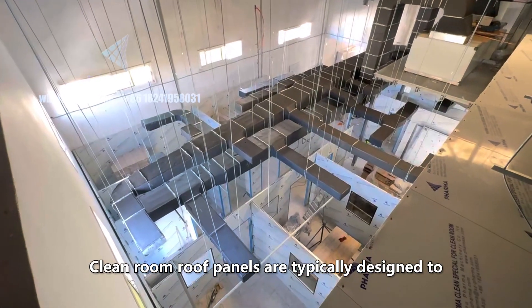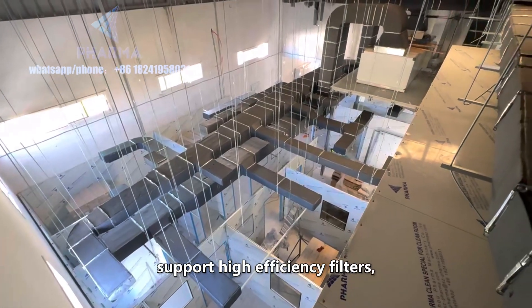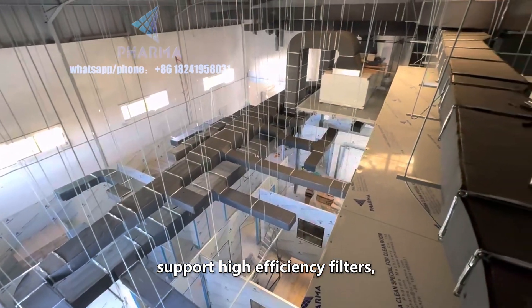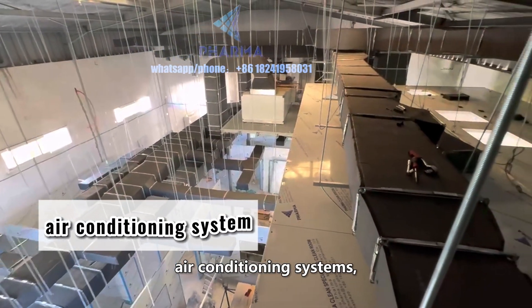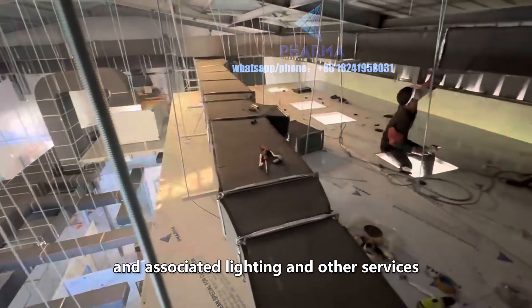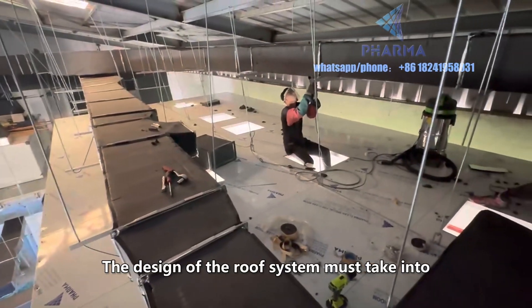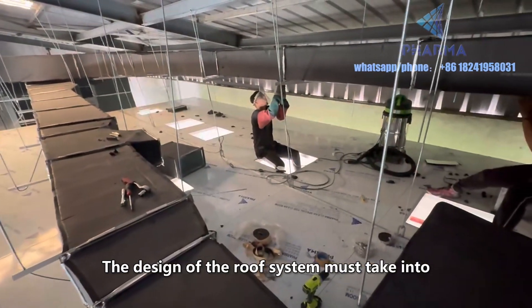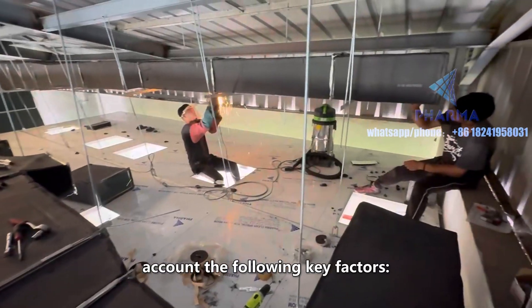Clean room roof panels are typically designed to support high-efficiency filters, air conditioning systems, and associated lighting and other services. The design of the roof system must take into account the following key factors.